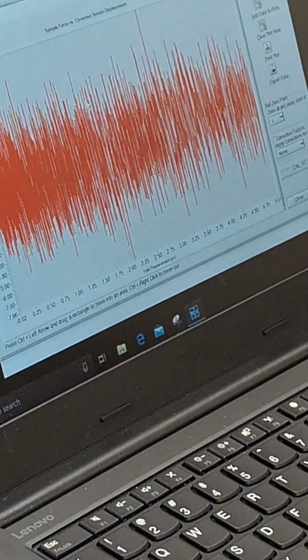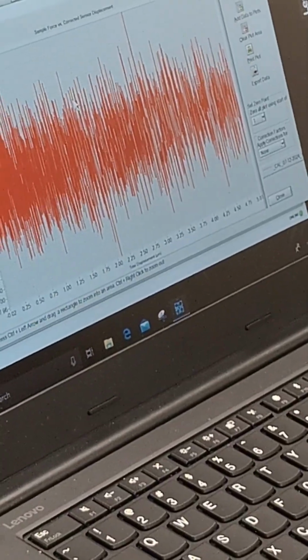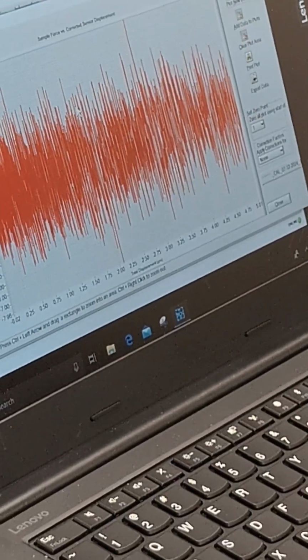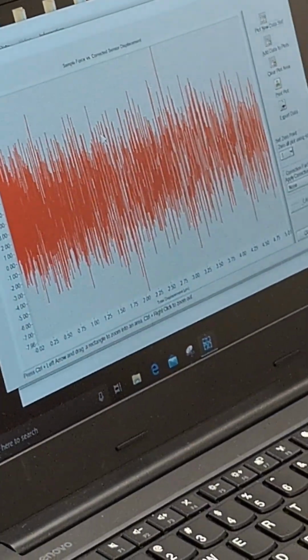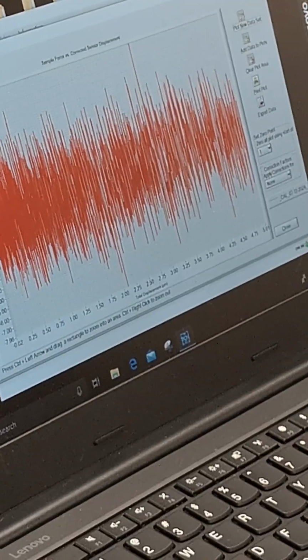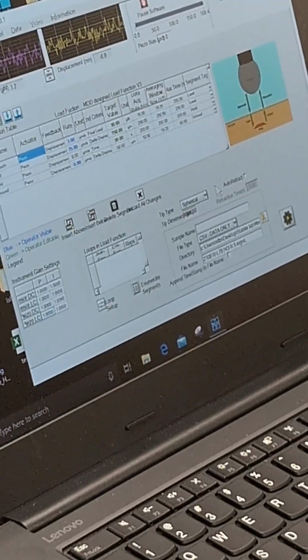And the force that you're going to indent, generally, from my understanding with my hydrogel, the minimum force is roughly around 100. So this is definitely within the range, but it is kind of large in terms of the error range. That's just the system flaw of this particular set. So now with that, I think we can go start.